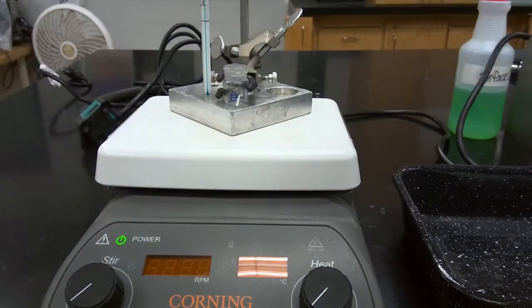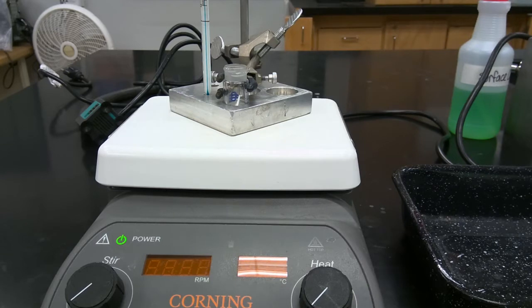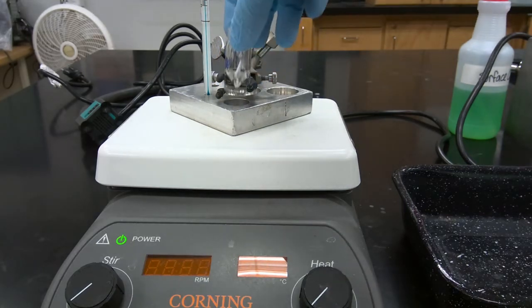drying tube. So our first step is we're going to add our reagents, which are the lauric acid and the ethanol, as well as the acetyl chloride catalyst. We'll then assemble the setup and begin heating our reaction mixture while circulating water through our water-cooled condenser to minimize losses of material. So we'll resume once we've added all of our reagents into our conical vial.